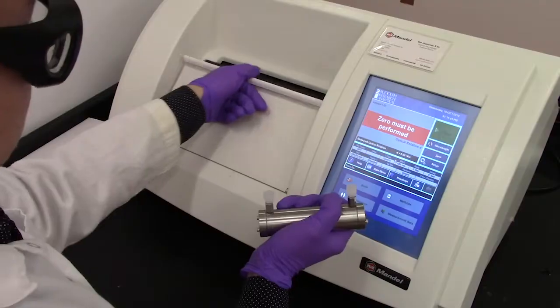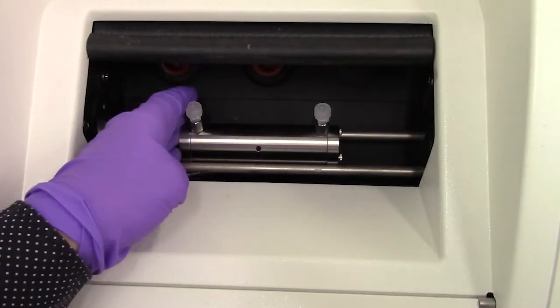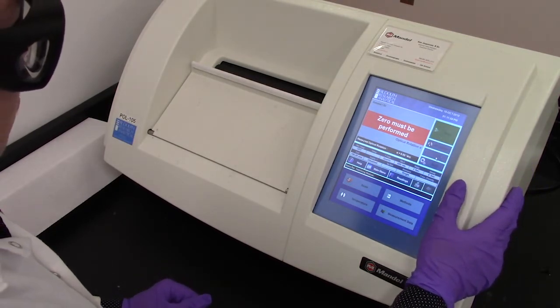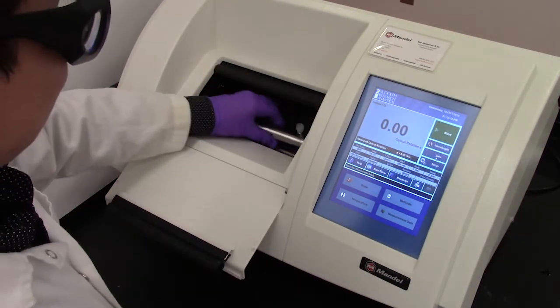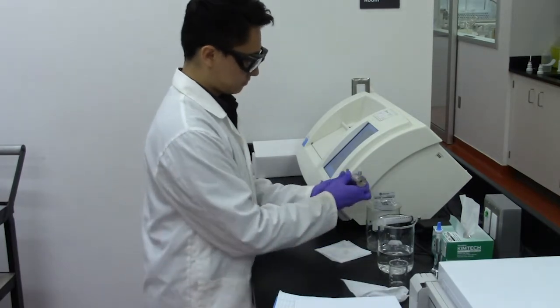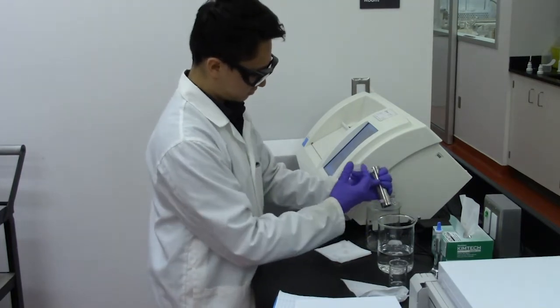Next, open the hatch in the machine and insert your blank. Note that the sample holder is placed between the two rails inside the machine towards the right side. Make sure the tube touches the right wall. Close the hatch and press 0 to calibrate the machine. After the calibration has completed, open the hatch and remove the blank. Empty the sample holder completely using a syringe filled with air and a waste beaker under to catch any spillage.